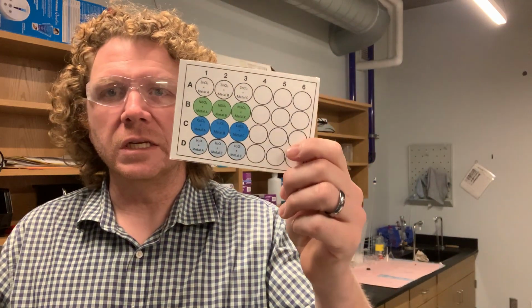For part 1 of your experiment, you're going to use this index card as kind of your staging ground for looking at the different reactions you're going to be evaluating. You're going to be using a total of 4 different solutions. Those solutions are zinc chloride, nickel sulfate, copper chloride, and deionized water, and testing how these different metals react with those different solutions.